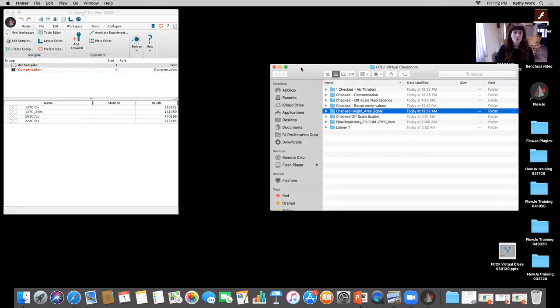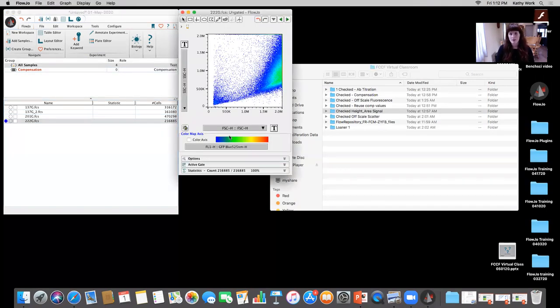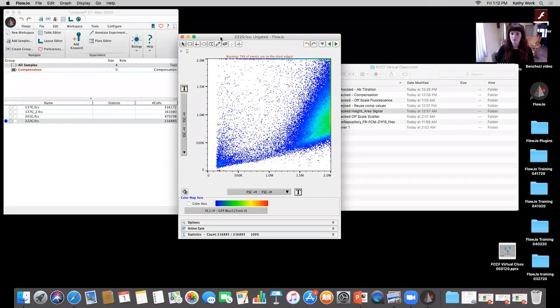So what I'm gonna do is take a look at this data file right here. It's 222G, and I needed to take a look at my file that I had run on the Cytoflex. So the first thing I saw when I opened it up is that everything's kind of plateaued, or everything's kind of at the edge. And you can see there's a little warning here telling you how many events are on the chart edges. So it's 74%.